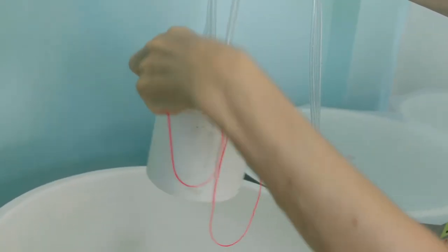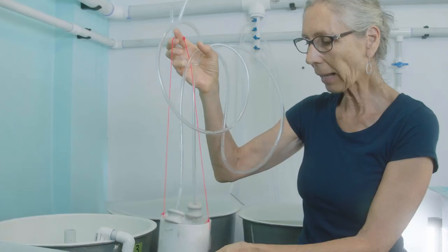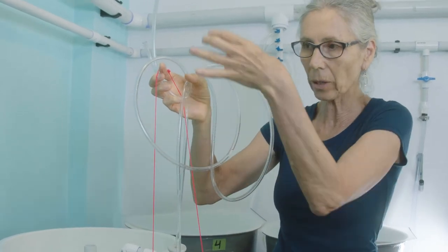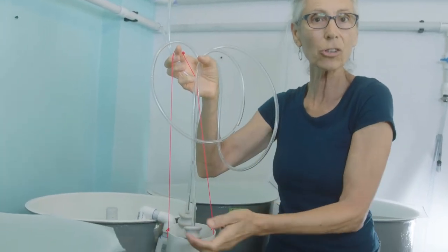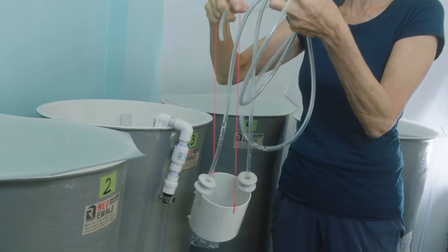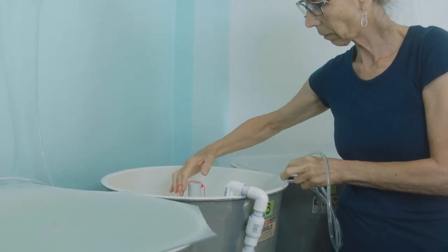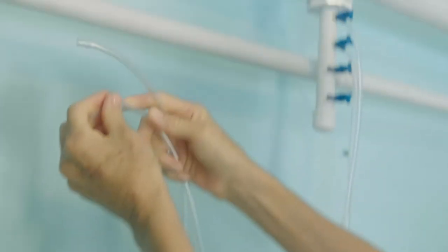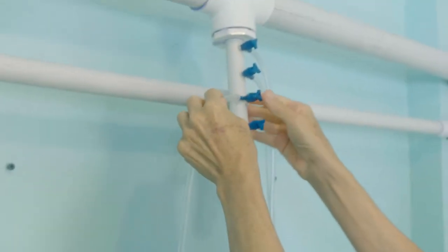The other piece of apparatus that goes into the tank is the airlift, and we use weights on it to make sure it positions correctly. The air comes in and pushes the water up through the column, picking up anything on the bottom and circulating it up into the tank so the veligers always stay in suspension — it's a very gentle aeration for them. I take this and hang it on the standpipe, then put the airline onto the air valve.